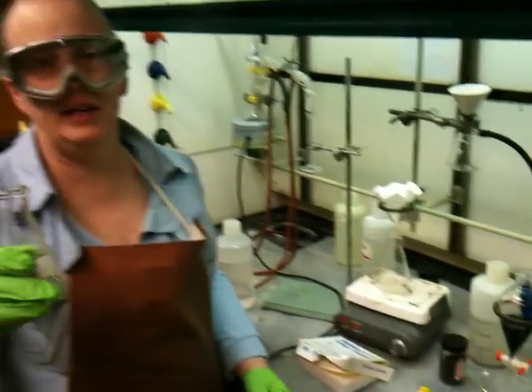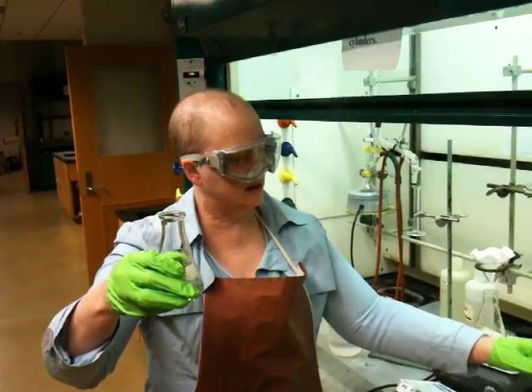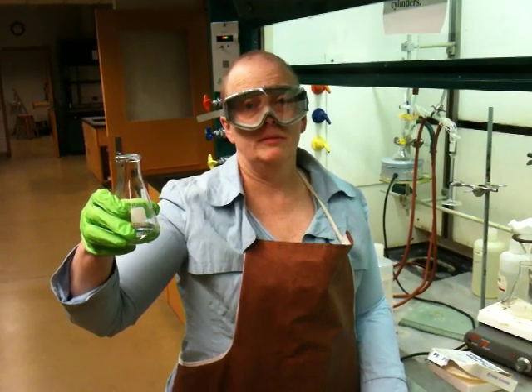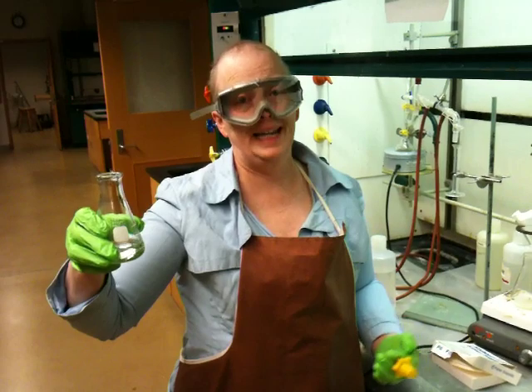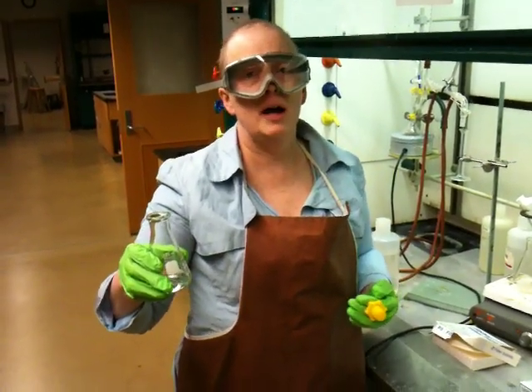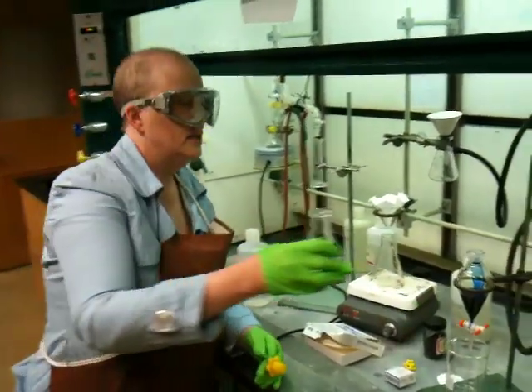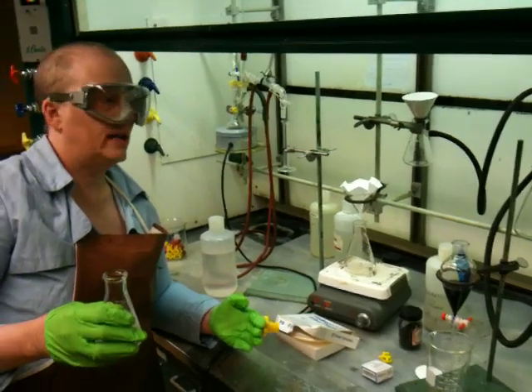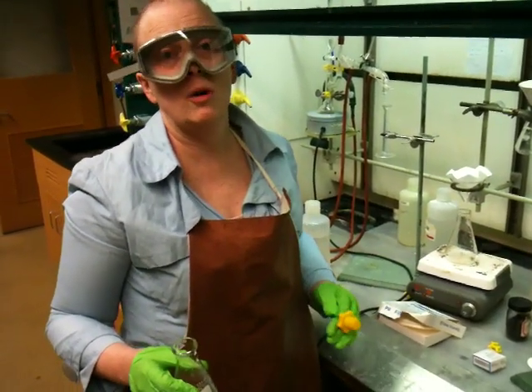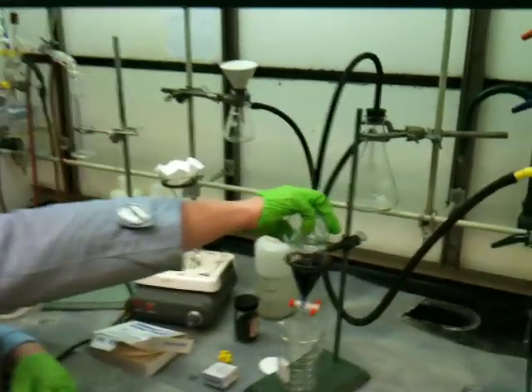What I'm going to add to this is a solvent that the dye is soluble in, so you will see some of the dye hopefully move from this aqueous layer into this layer. This is dichloromethane, and dichloromethane is almost completely insoluble in water — it's what we call an organic solvent. Very often organic chemists do extractions with organic solvent because they're trying to remove organic molecules from other inorganic molecules that would not be soluble in the solvent. You pick this solvent based on the solubility of the compound you're trying to isolate. One of the big issues that all chemists face on a daily basis — and professional chemists do this technique every day — is we don't know which layer is which.